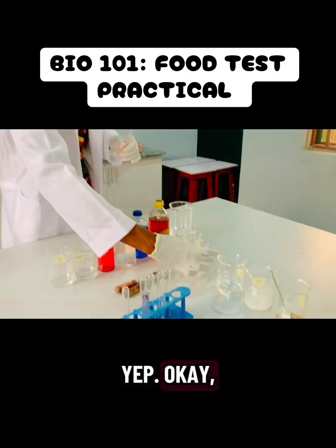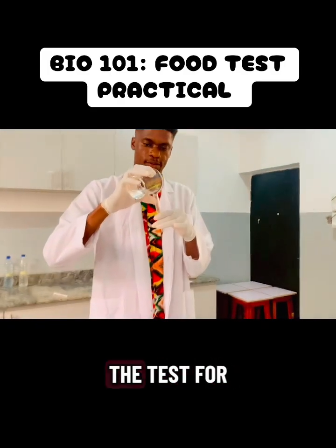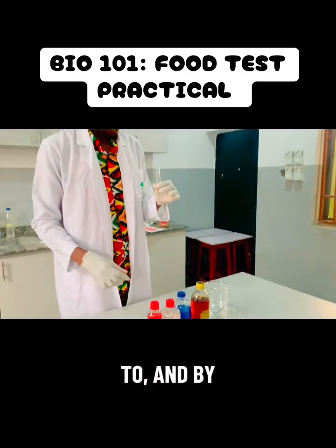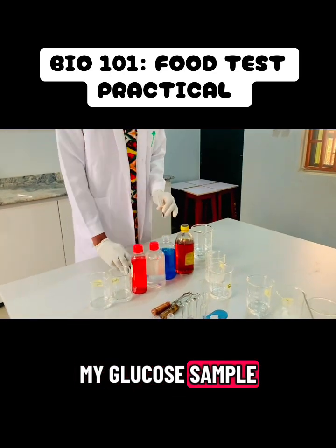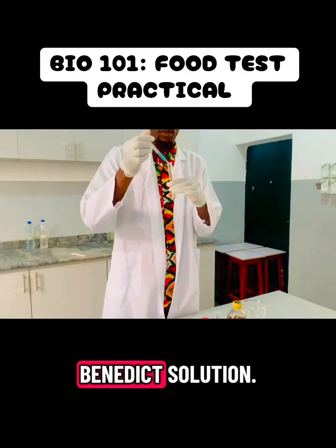Okay, so the second food test is the test for sugar, and by sugar I mean glucose. So I went in with my glucose sample and then my reagent. For this I'm using Benedict's solution.